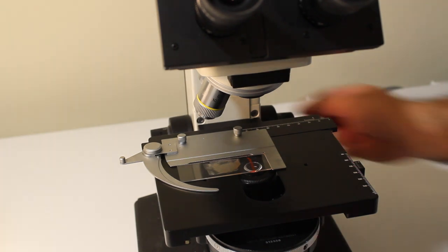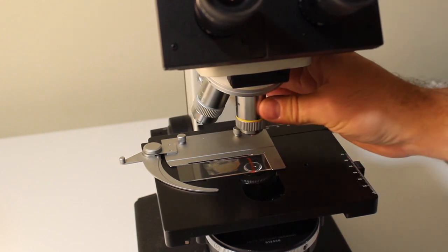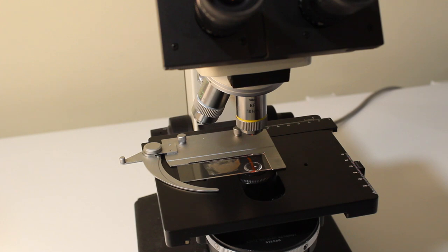What I want to do next is turn on my light source and swing into position my lowest magnification lens. You always want to be starting with your lowest magnification lens because this is the easiest lens to find your focus on.